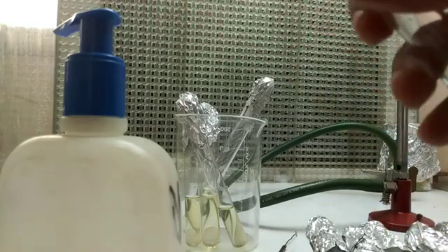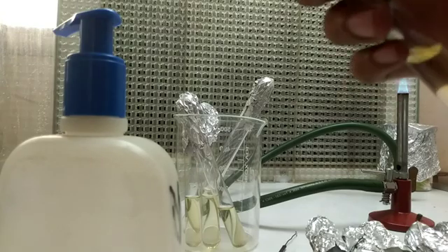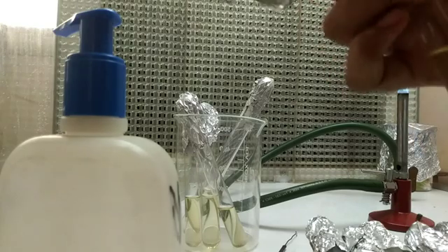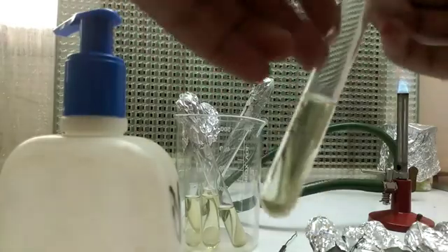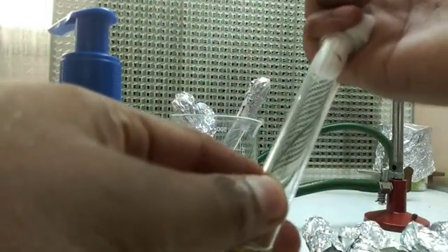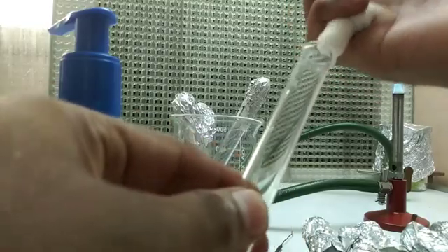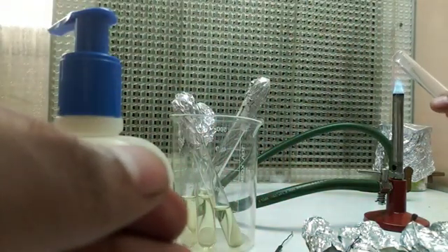Remove the aluminium foil from the top of the test tube. Hold the test tube with your little finger, remove the cotton plug, and heat the mouth of the test tube on the Bunsen burner to maintain sterility.